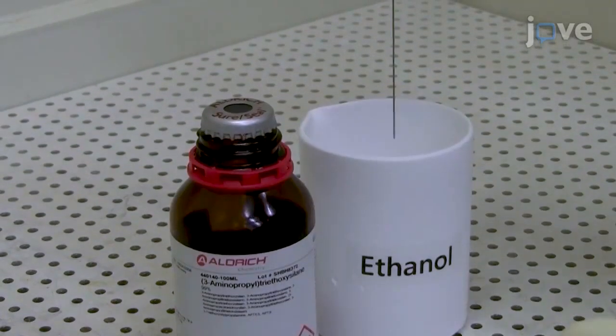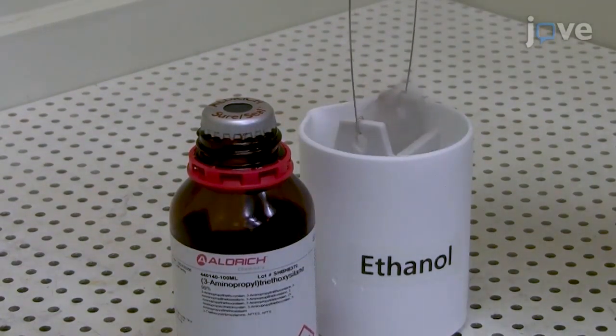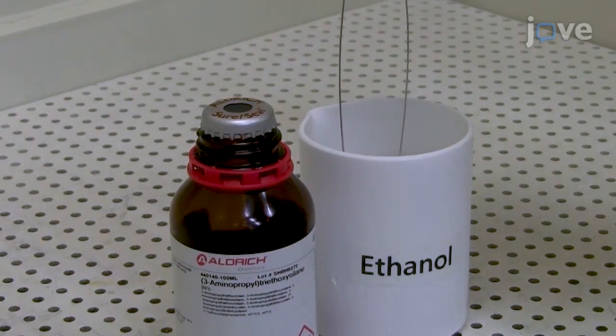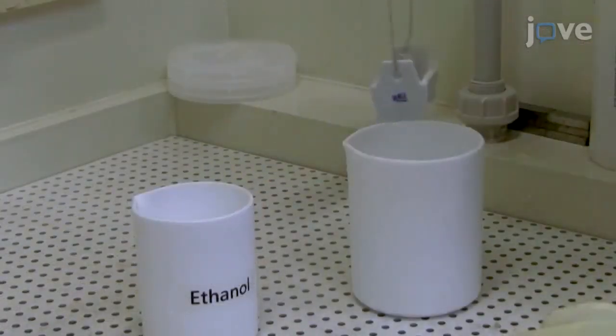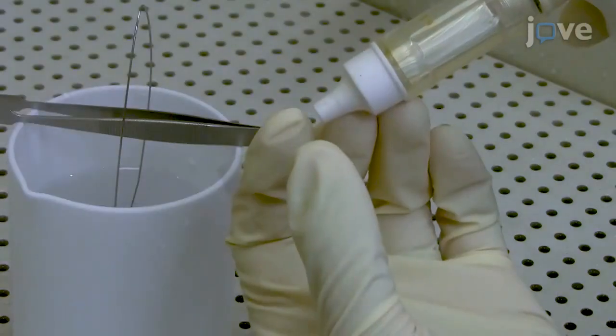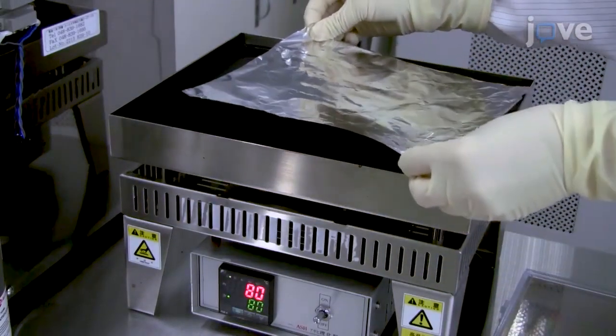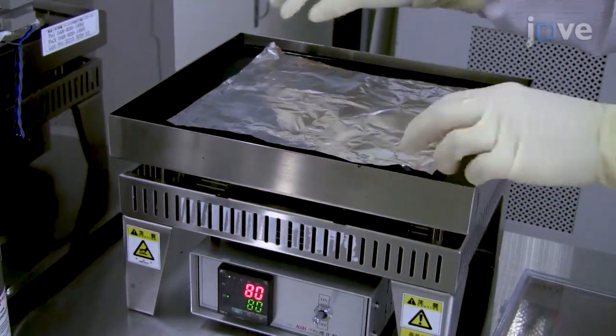Prepare 0.05% aminosilane solution. Immerse the cover glass in this solution and incubate it for 1 hour at room temperature. Rinse the cover glass 5 times in pure water. Then dry the cover glass using an air gun. Bake it on the hot plate at 80 degrees Celsius for 5 minutes.